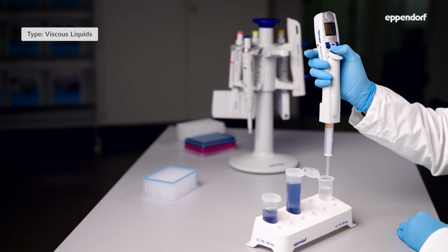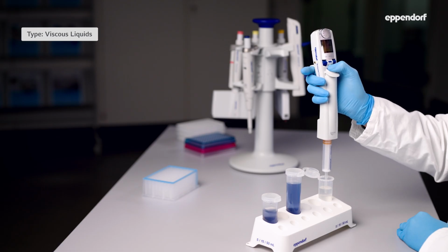With an air cushion pipette, the best solution is to adjust the pipette to the liquid. Use the reverse pipetting mode and pipette slowly. Of course, the ideal choice for pipetting viscous liquids is again the positive displacement system. With syringe-style tips you can easily pull liquid into the tip and push it out without leaving any residue. And here's a pro tip. When you're using highly concentrated glycerol, it's best to use the Visco tip. It's specially optimized for that liquid.